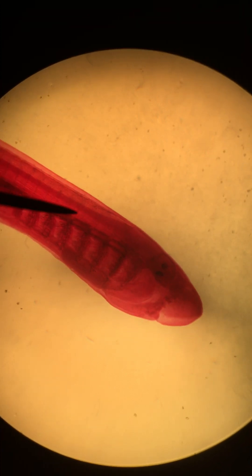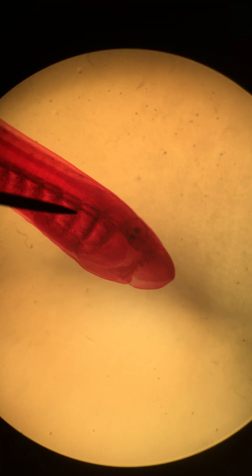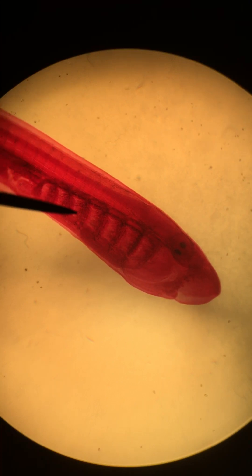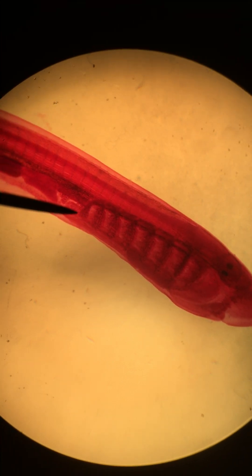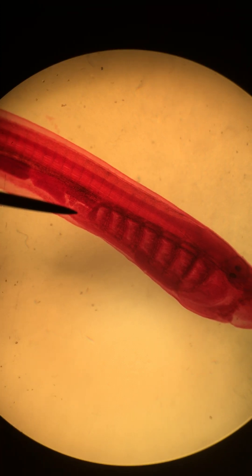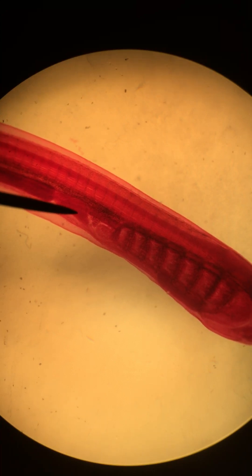I'm going to come back to the head here and show you the pharynx. All of this right here is the pharynx, and then just behind that, just caudal to that, is the heart — where I have the pointer now, this is the heart. Behind that, just caudal to that, is the liver.